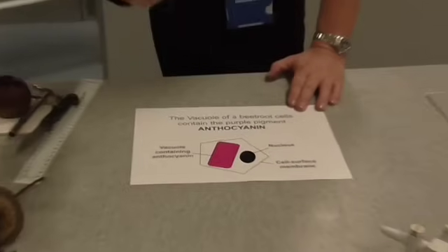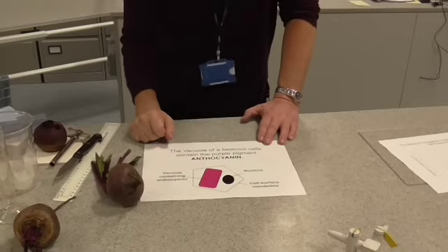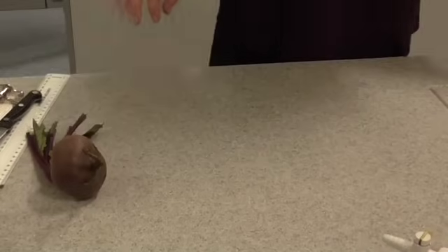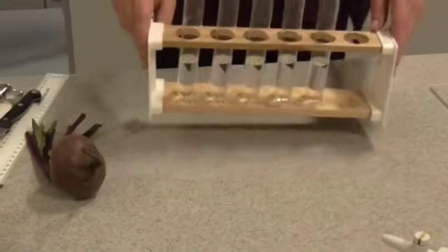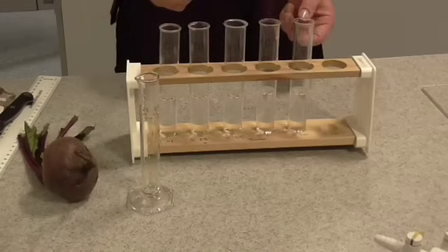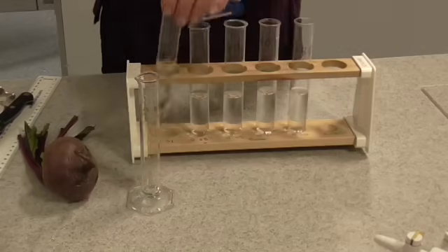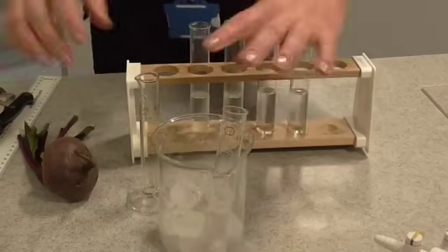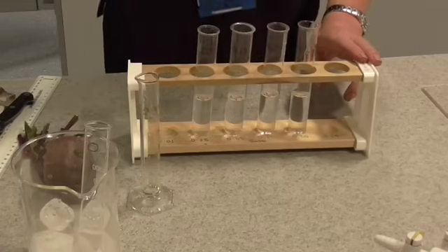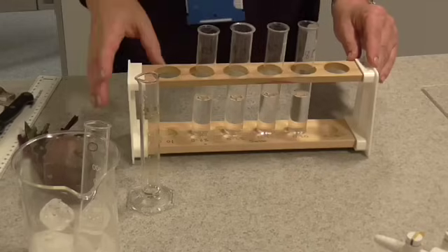What we're going to do is put beetroot tissue in various conditions — various temperatures — and see how much red anthocyanin escapes from the cell membrane to work out the effect of temperature on cell surface membranes. The first thing you have to do is get yourself some boiling tubes with 20 centimetres cubed of water in each. You're then going to place these in water baths set at different temperatures: zero degrees in an ice bath, and then 20, 40, 60, and 80 degrees Celsius in various water baths. Leave them to equilibrate — in other words, to come to the desired temperature — whilst you prepare the rest of the experiment.